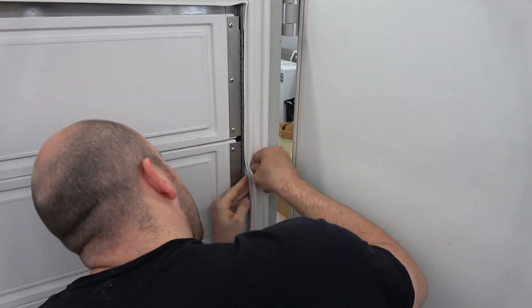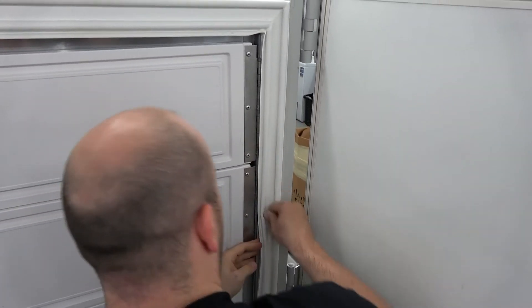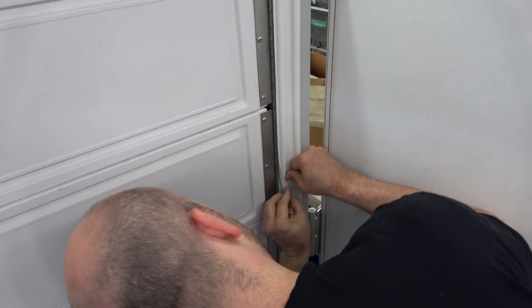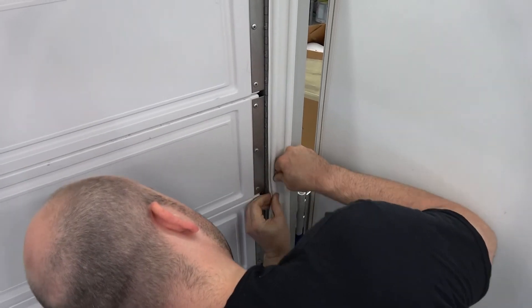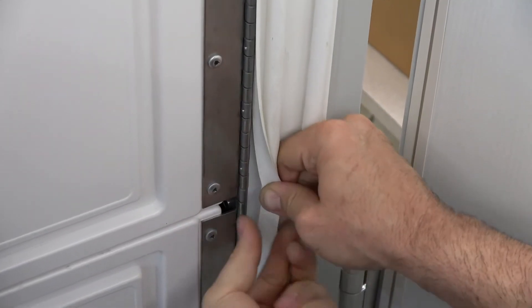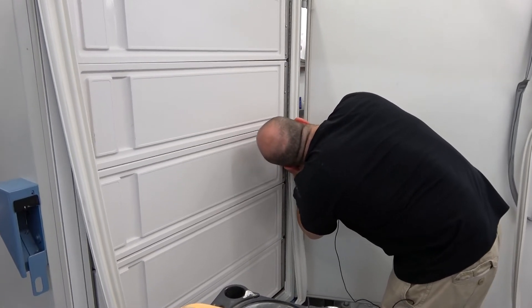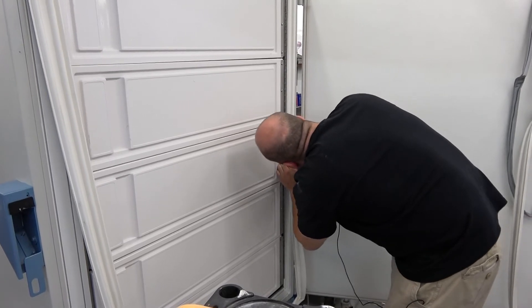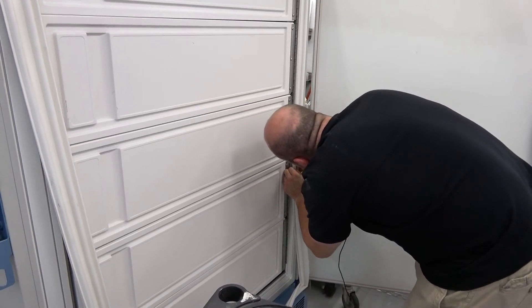It's really important to have good seals. Even if you treat them nice, they won't last forever. A lot of people let ice build up too much by opening and closing their freezers too often and not letting it defrost once in a while. You can start ripping seals, or your door gets frozen shut and you have to get in there with a screwdriver to pry it open — and you just ruined your seal. I said it was simple to do, but it does take a little bit of physical work.